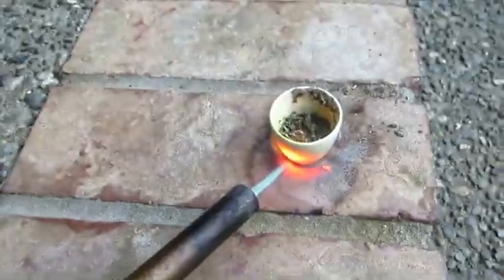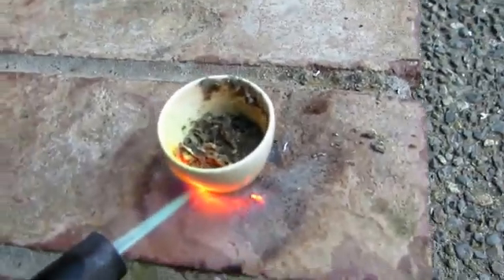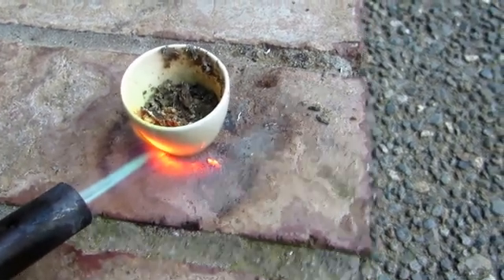What I'm now going to do is chop it up into some smaller pieces, stick it in a crucible, and melt it down into a tiny zinc ingot for our element collection. I've got my little crucible here and our zinc metal is inside. There's a bunch of slag on top, but by now this zinc metal should be molten.